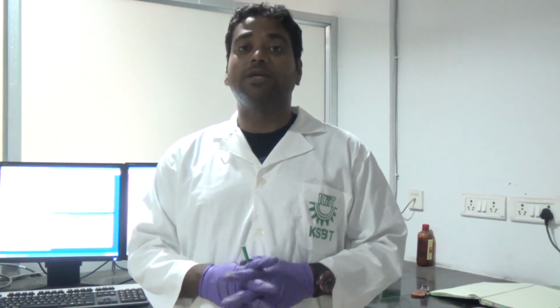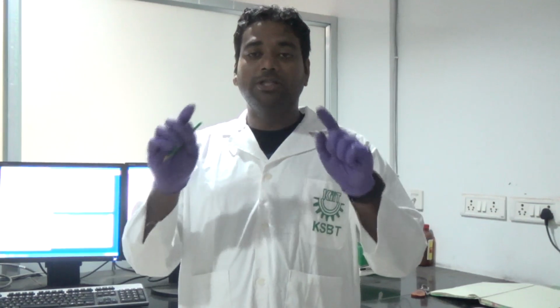Next, suppose for example you take a blood sample. A blood sample contains different types of cells. We generally consider blood as a heterogeneous mixture of cells. In normal cell culture, we are using a homogeneous mixture of cells, which means only single-type populations.